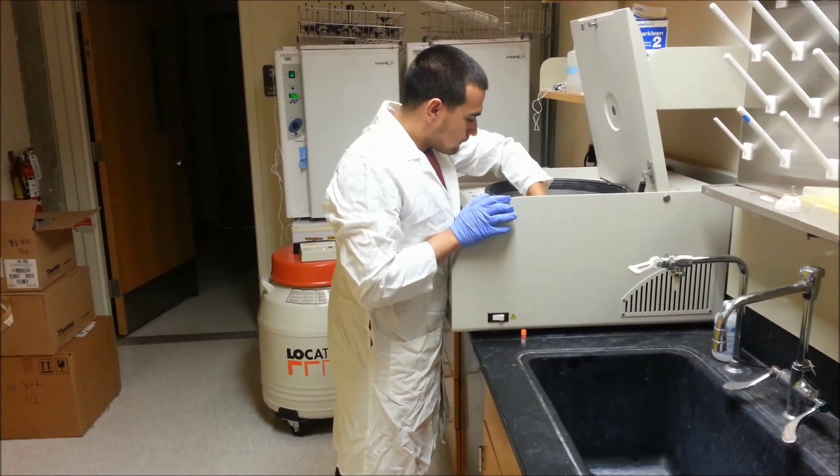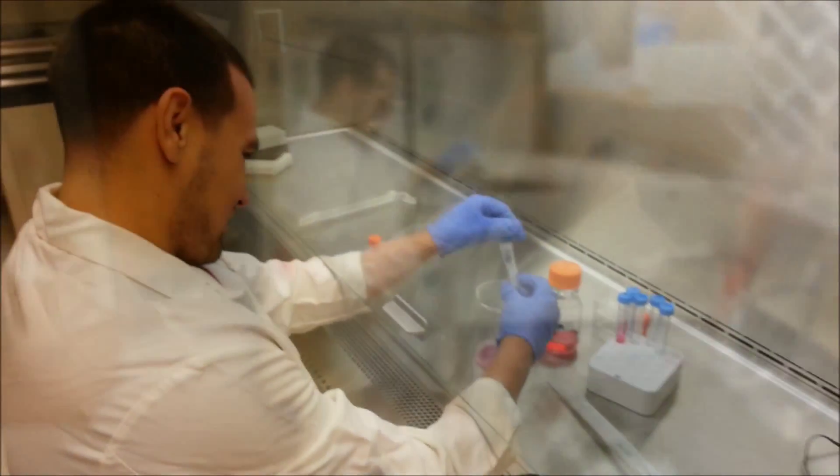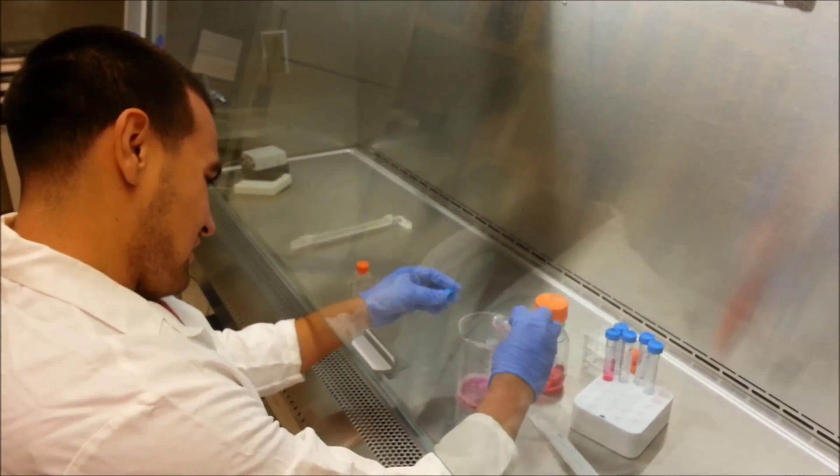Centrifuge the cells to pellet them. Decant the media or remove with a vacuum line.